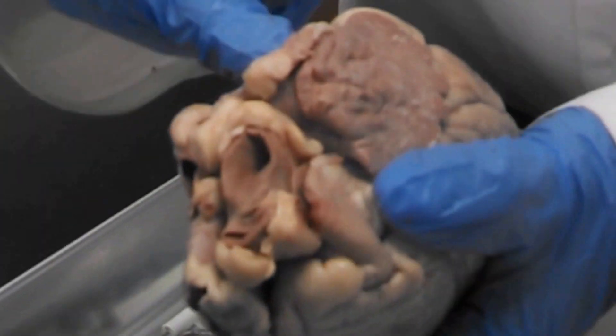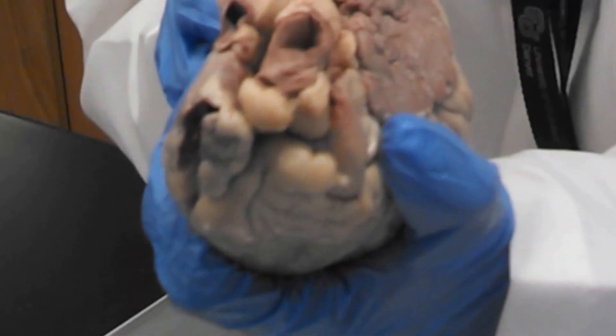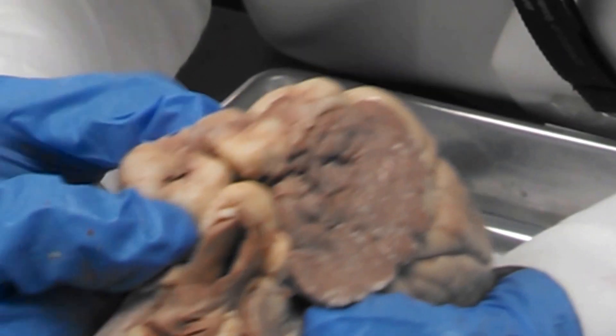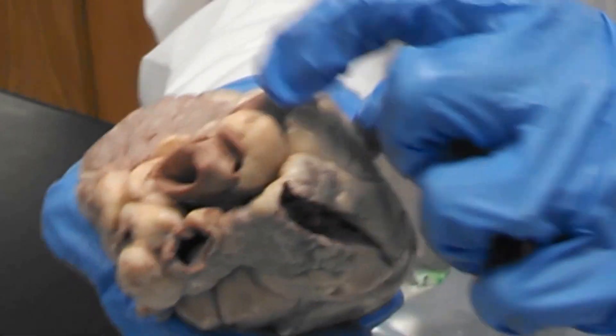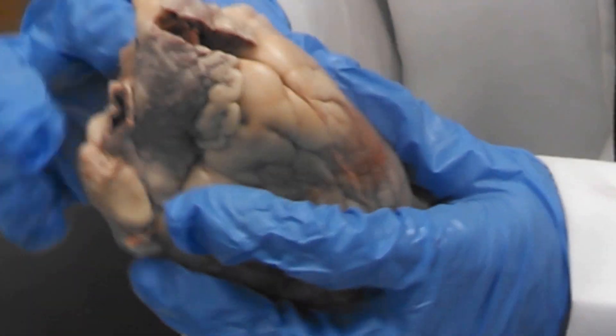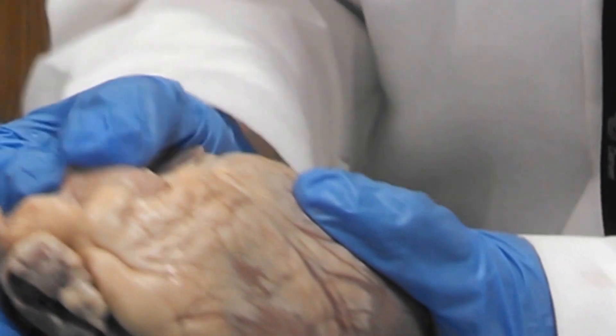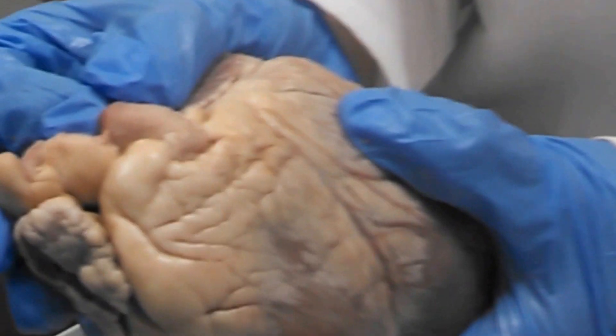Here we have the left atrium, and coming into the left atrium — I can actually move my finger in here — this right here is going to be one of our pulmonary veins. We have additional pulmonary veins here, and the pulmonary artery leading away from the right ventricle is this tube-like structure on the front.